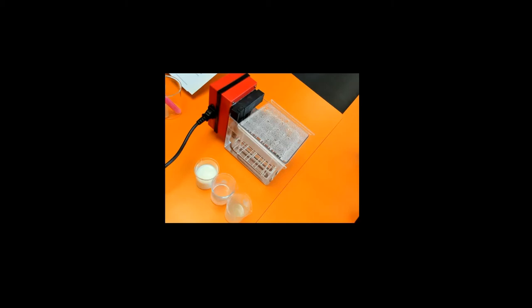Over here I've got a beaker of some milk. Now as you know, if you leave milk for a few days at room temperature it will go sour. The reason for that is because bacteria in the milk will start the decay process. Bacteria use enzymes to produce acidic molecules, which is why the milk tastes sour and acidic as well.